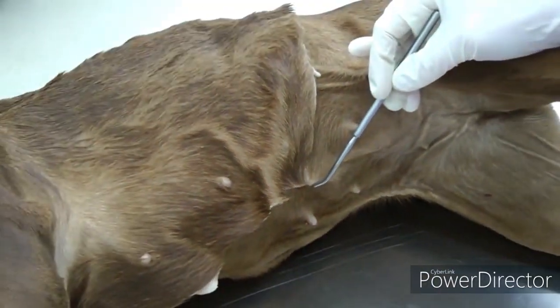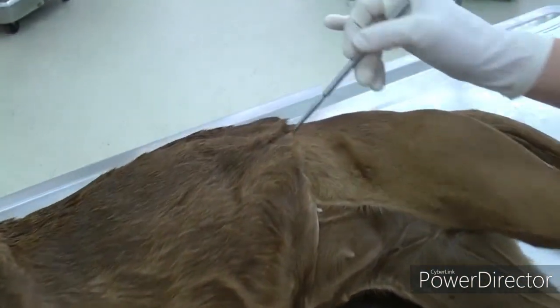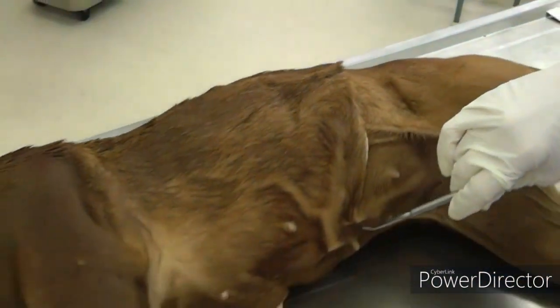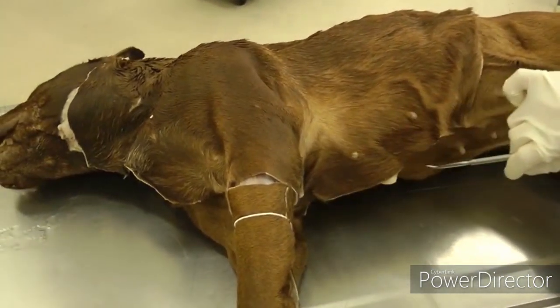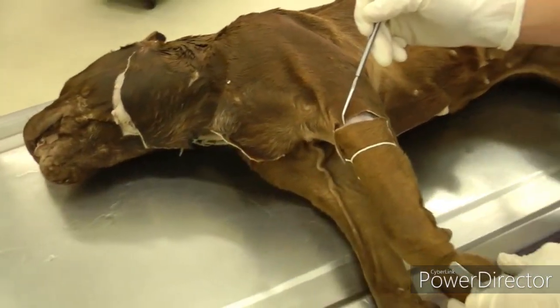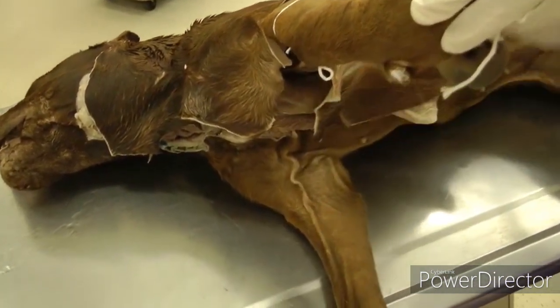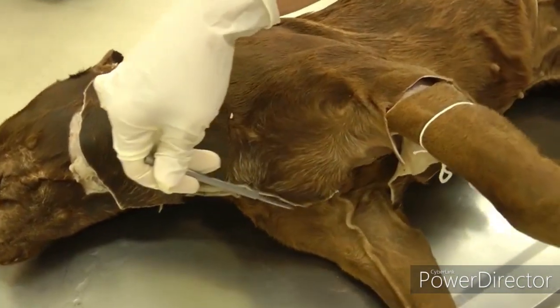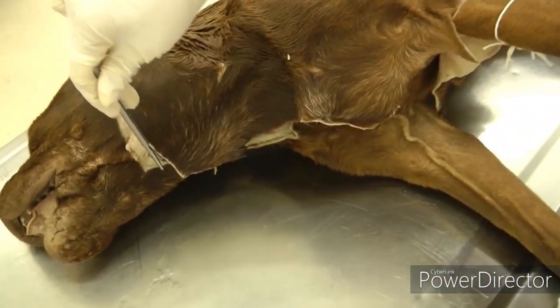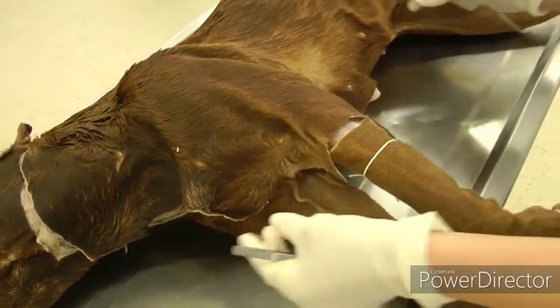You're going to make an incision on the left side going from the umbilicus up to the dorsal midline of the back. You're also going to go from the umbilicus up the midline ventrally of the belly, then encircle the forelimbs — make a cut down, go around the elbow area, and continue that midline incision up the neck and then up behind the ear. Then peel back your skin.